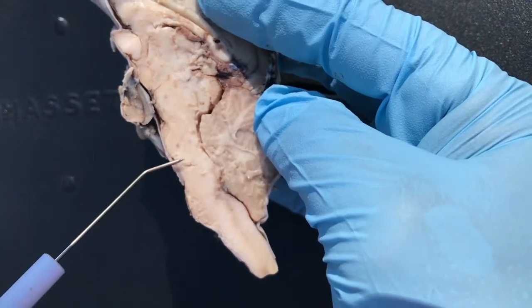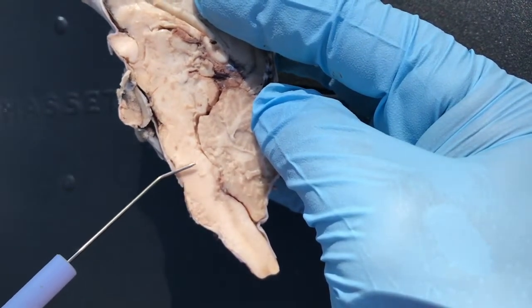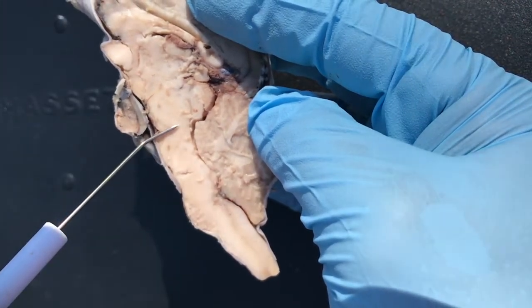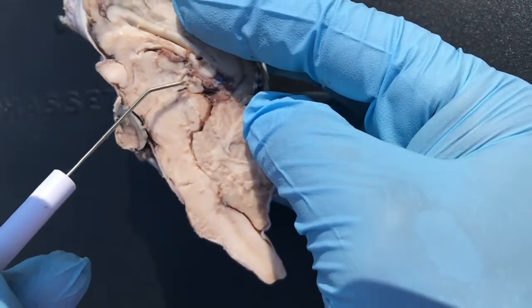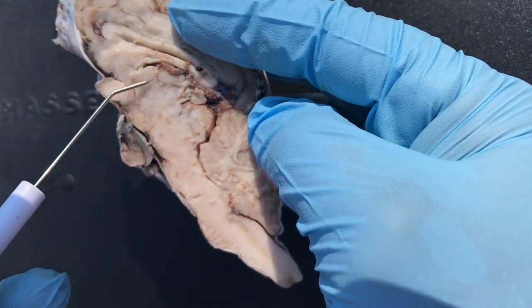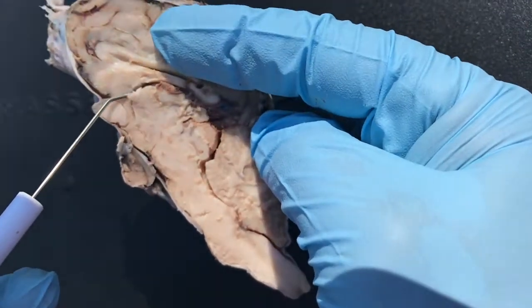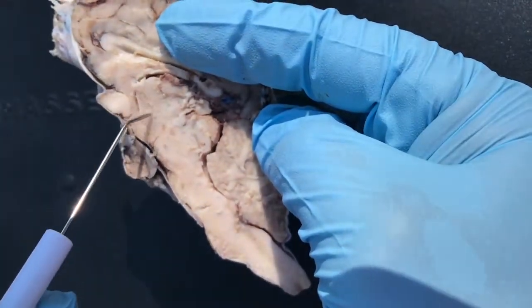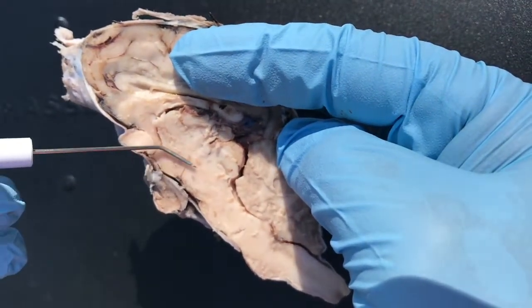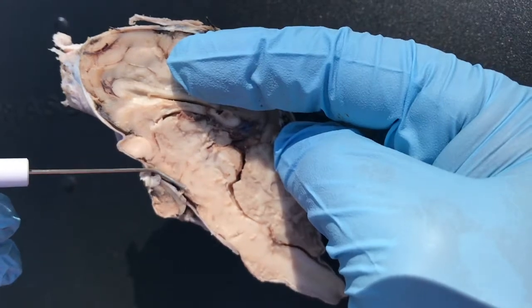Then above the pons is our tegmentum, and that goes all the way up from the top of the pons all the way up like this. Then we have our thalamus — all this area is the thalamus. You see where you have the third ventricle here, so this is the thalamus here. And then just adjacent to that, this area here is the hypothalamus.